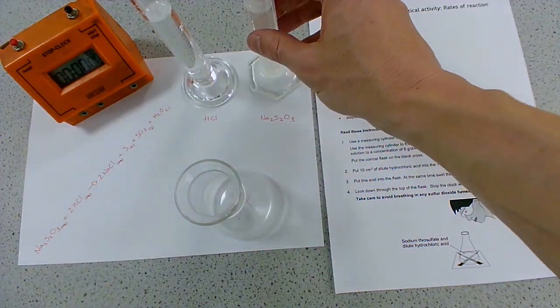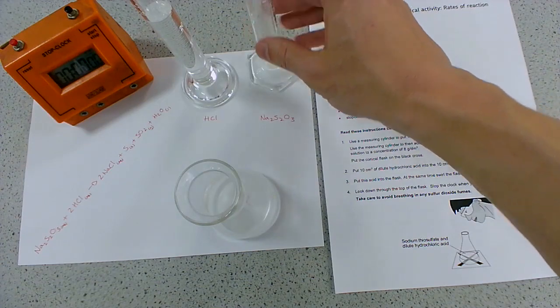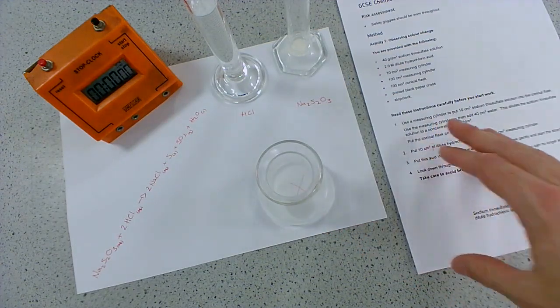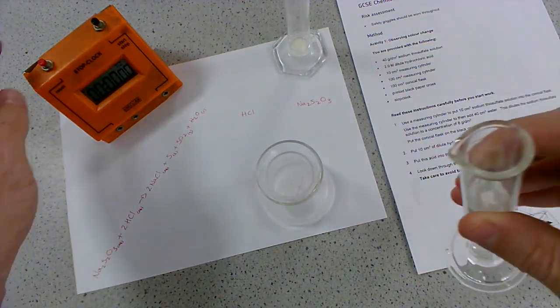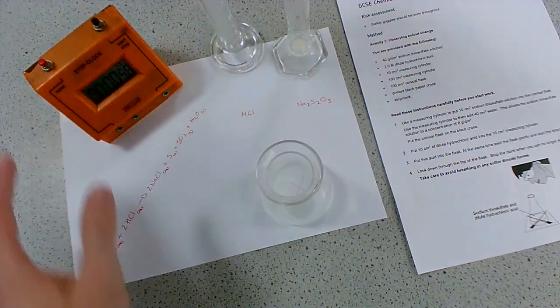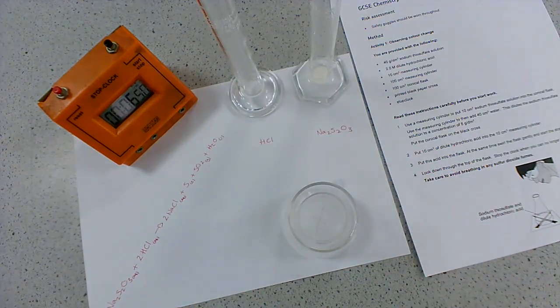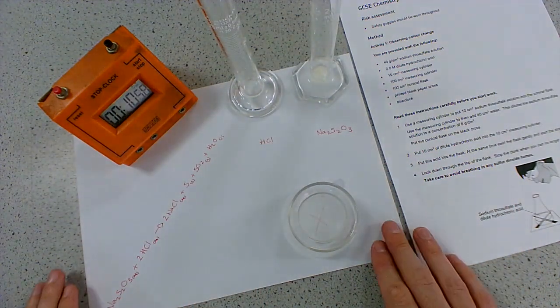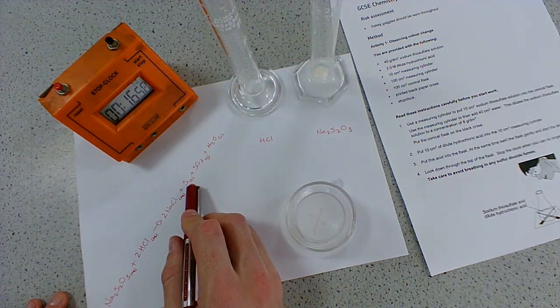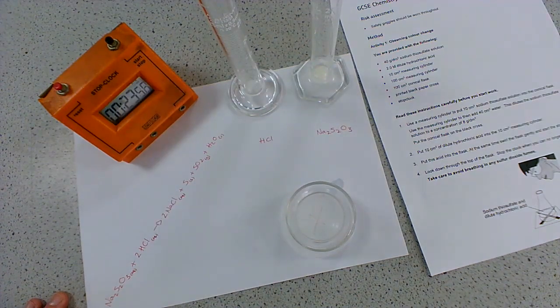I'm going to add my thiosulfate first. You'll notice that you can still see the cross. Then I'm going to add my hydrochloric acid second, and as soon as I've added it, I'm going to start that timer. In it goes - start the timer. Give it a little swirl, and then we're just going to keep an eye on it until we can no longer see the cross. Because we're getting solid sulfur being produced, it's going to turn a very cloudy yellow colour, and as soon as enough sulfur has been produced, we will no longer be able to see that cross.